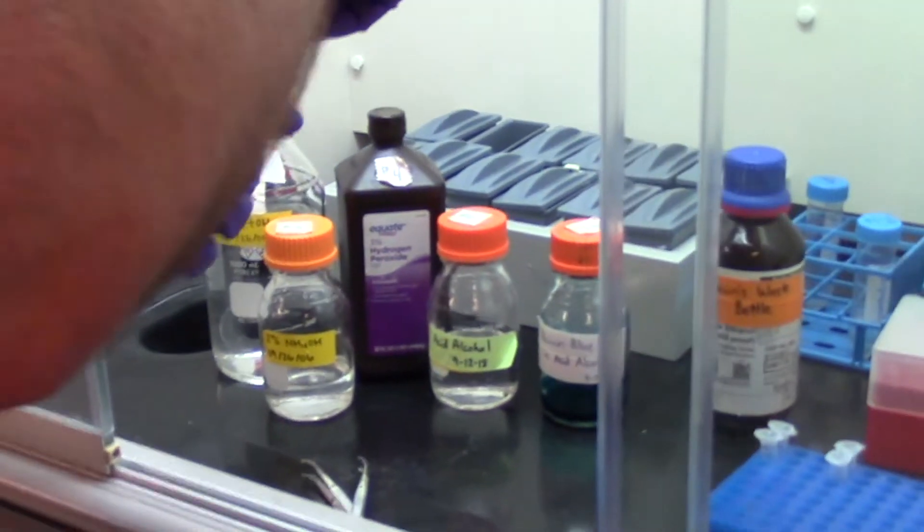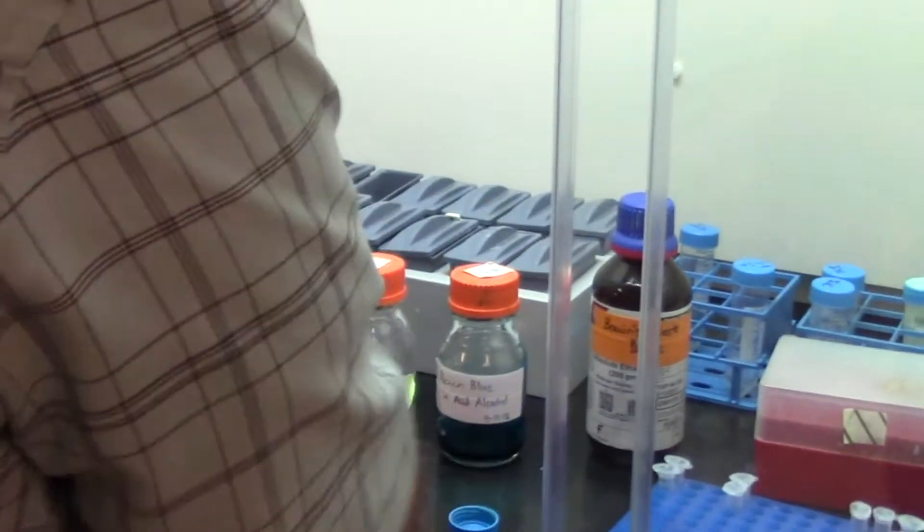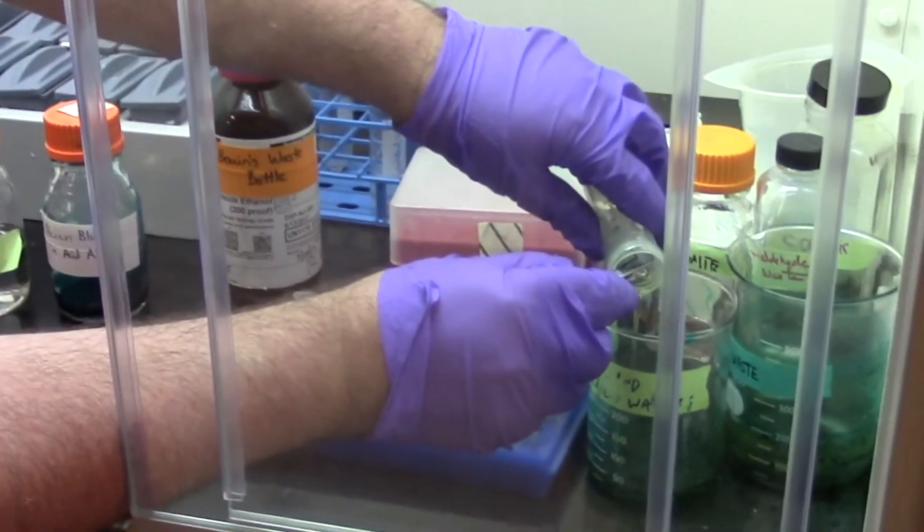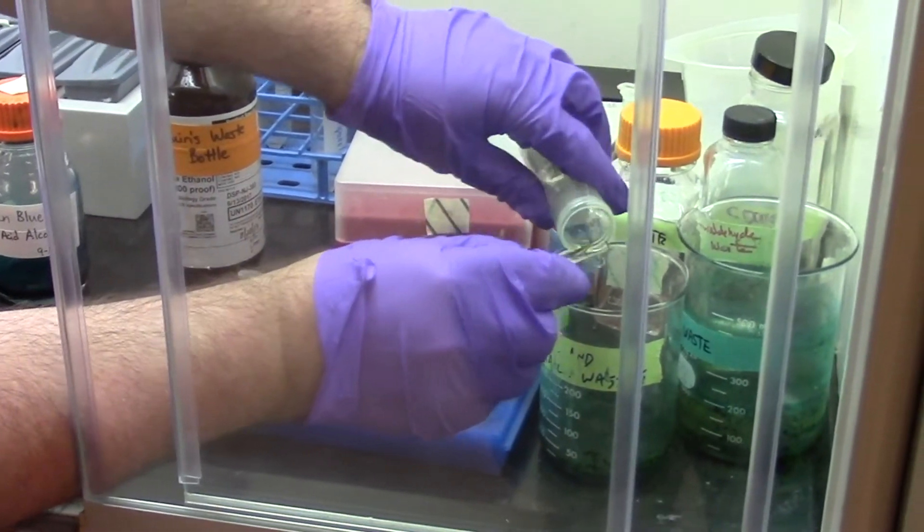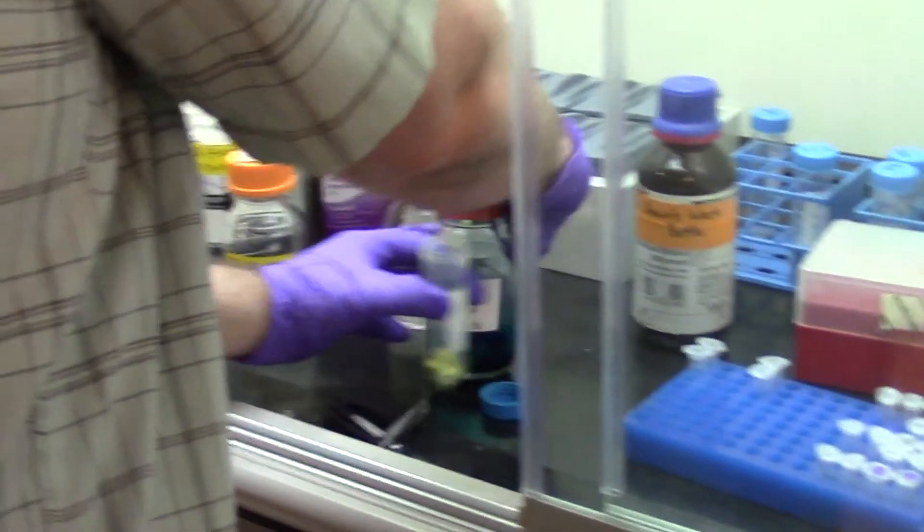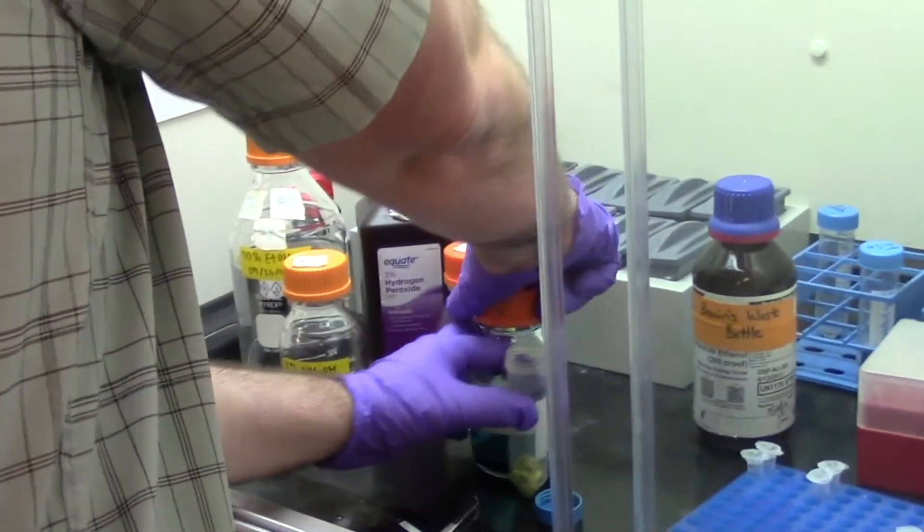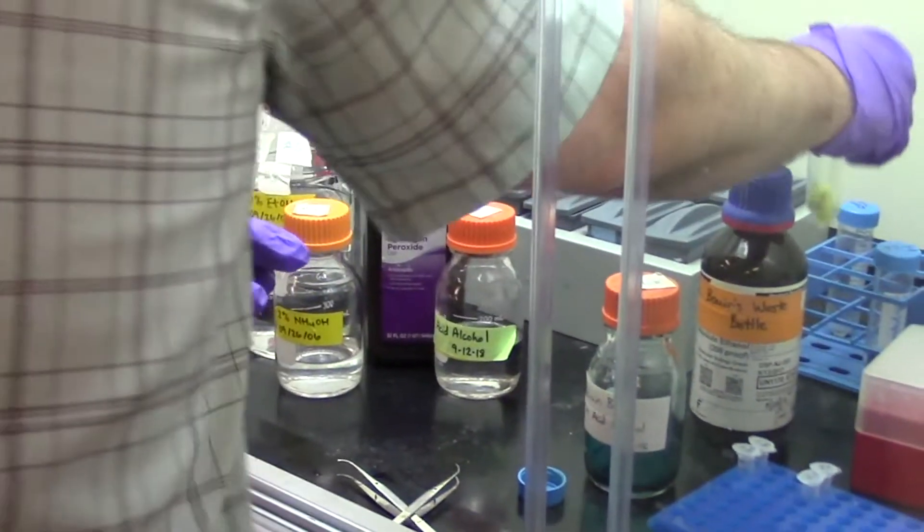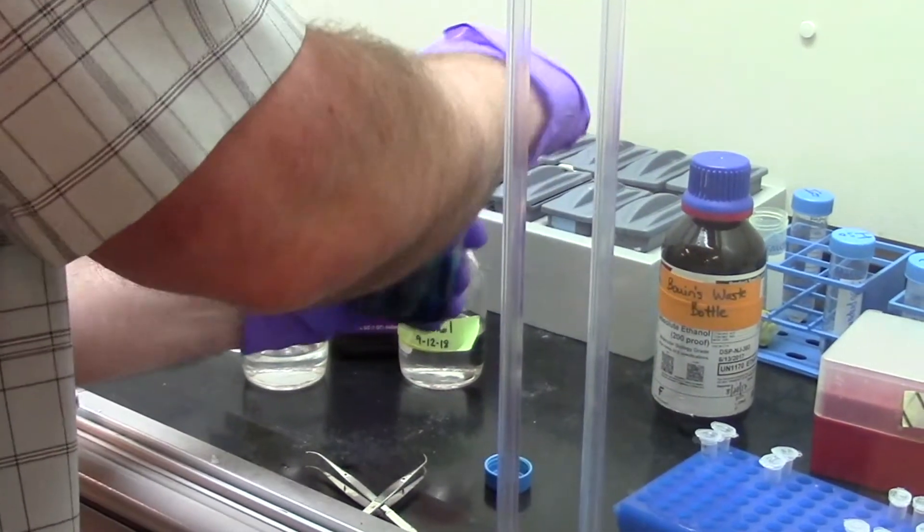The final step after using the acid alcohol is to apply the dye. I now submerge these.